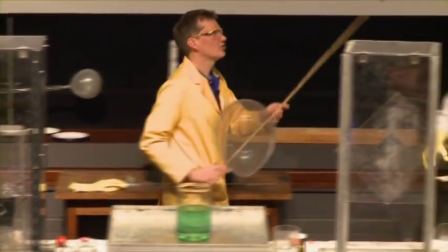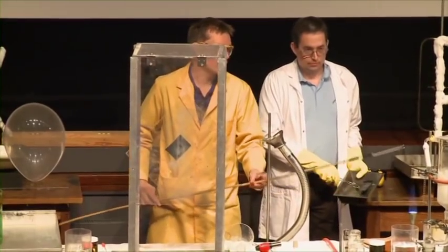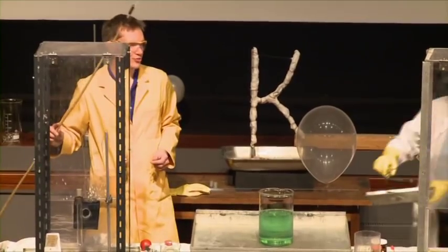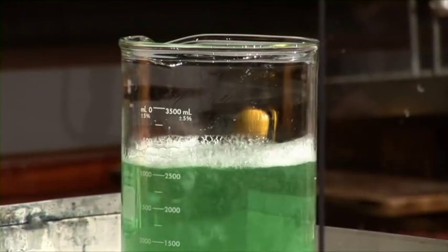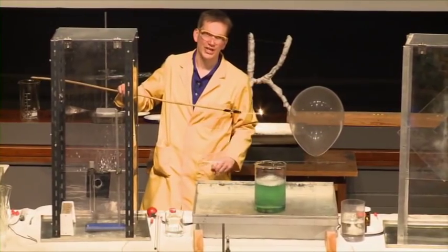So Mark is going to add some sodium hydride. It's all wrapped up in a gauze. So this should sink to the bottom of the beaker here before it reacts on the surface. There we are. Lovely. So this is now sunk to the bottom. Bubbles are forming, and this is the hydrogen gas.